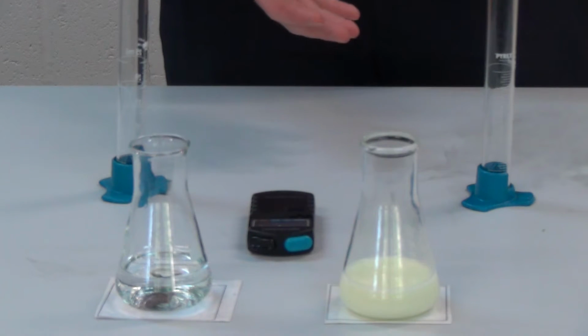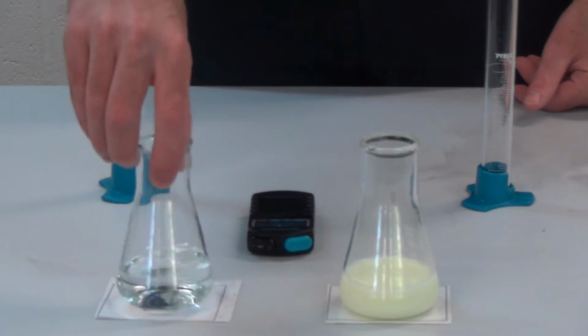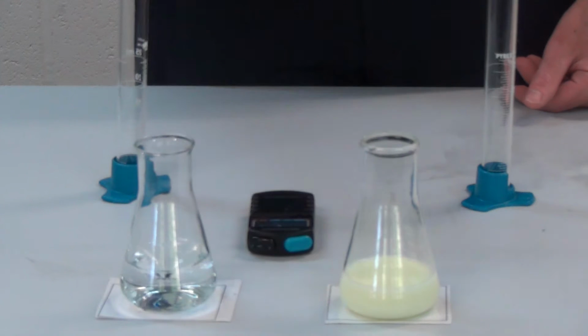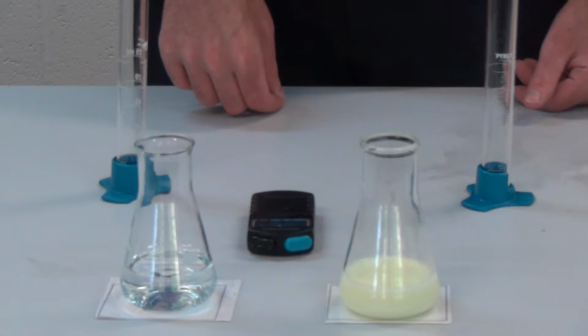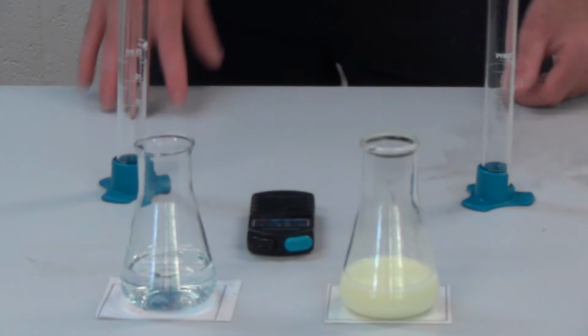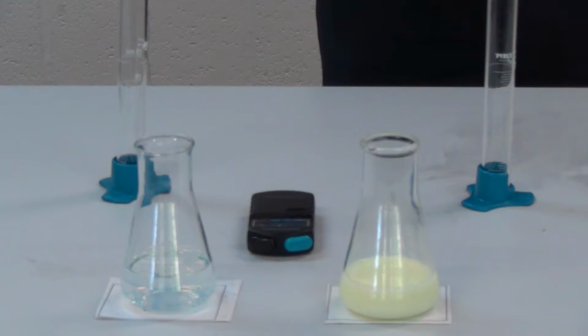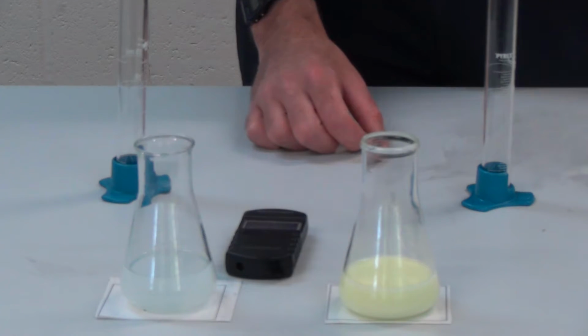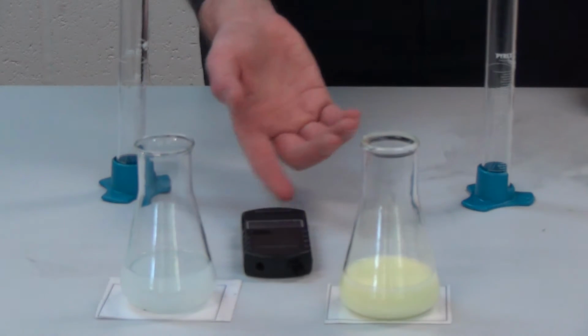If I leave it for longer, then eventually this will go cloudy, and I can see it's getting a little bit cloudy, but not a lot. We give it a really nice stir, but it's still going to take a while. So it's starting to get cloudy, but it's going to take forever. So what we'll do is we'll speed up the video in post-process. I can't see the cross anymore, so I'd stop my timer. And you can see that one took 2 minutes and 17.